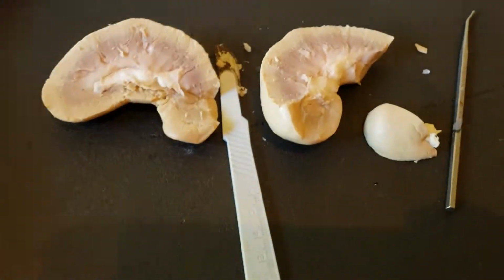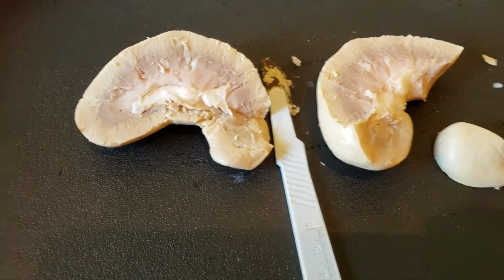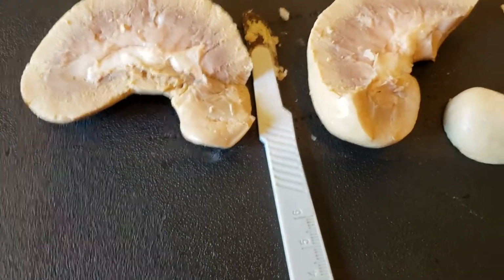But anyways, final dissection. I think there's one more video presentation actually, so one more, but last dissection. If you want to check on my laptop, all I have is this up so I can go through in a nice orderly manner. And here is the kidney.